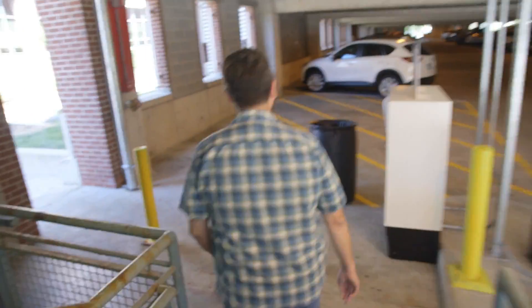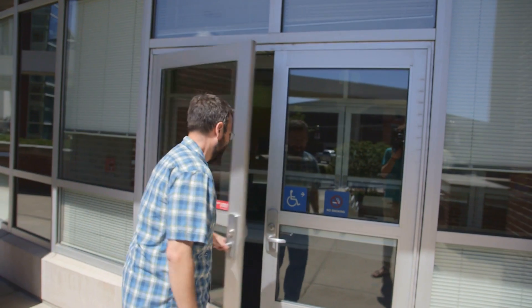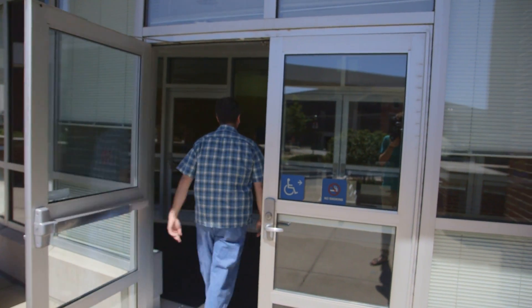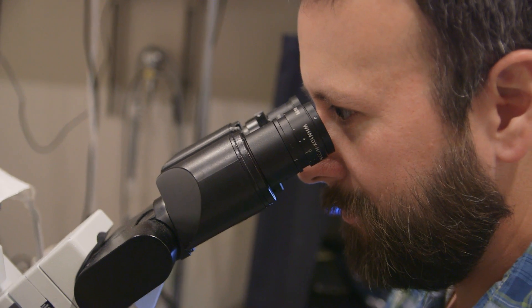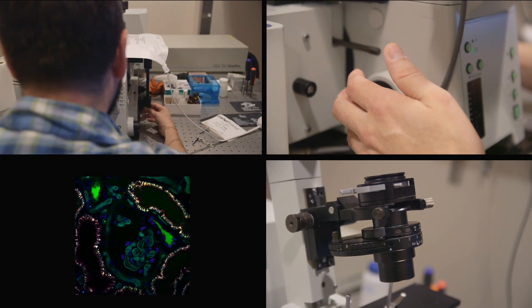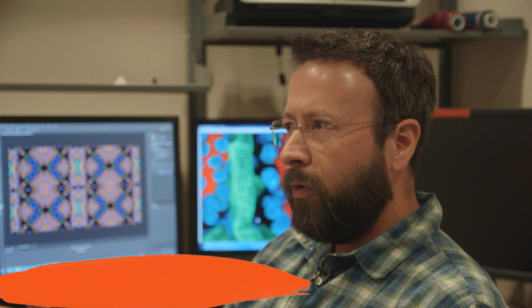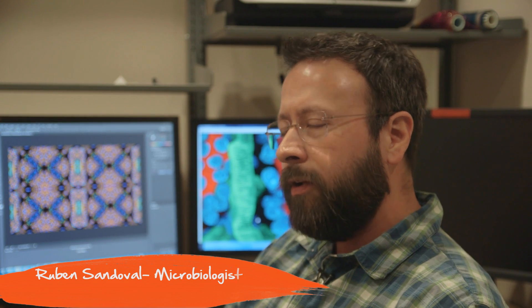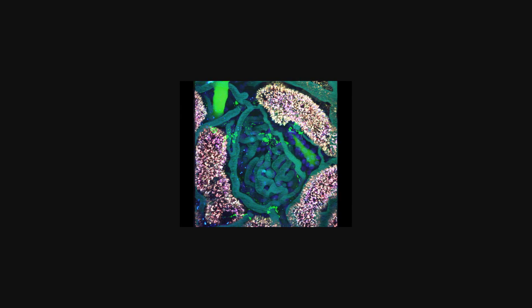I'm Ruben Sandoval, and I've been working at IU School of Medicine for about 21 years. My basic area of research is heavily dependent on microscopy — that's looking at images on the microscope to help solve questions. It's essential that you have a way to distinguish different compartments within the cell and what they're doing in relation to one another.